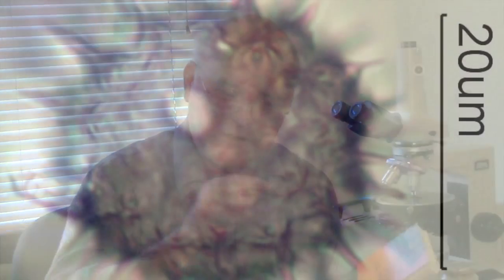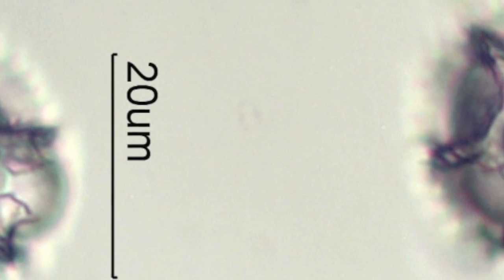Whether they have spikes on them, whether they are multiple grains of pollen, whether they have a particular structure that stands out — that would help us rapidly identify that pollen grain.